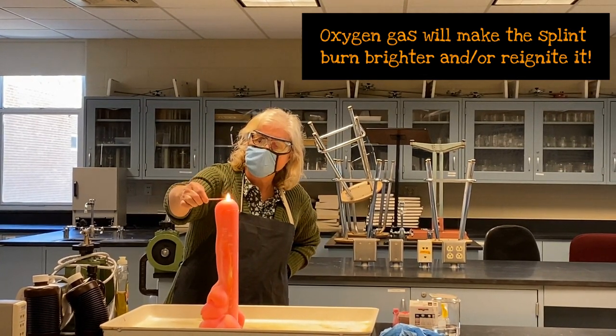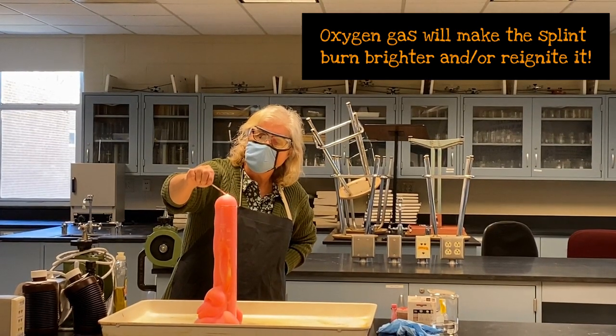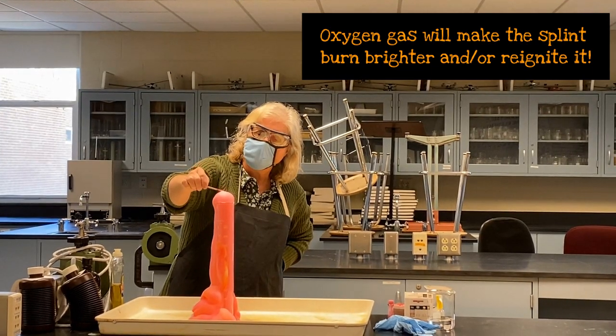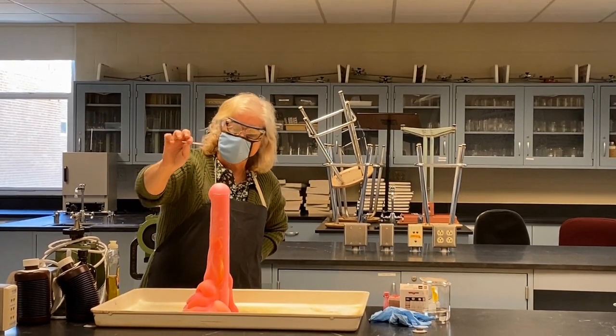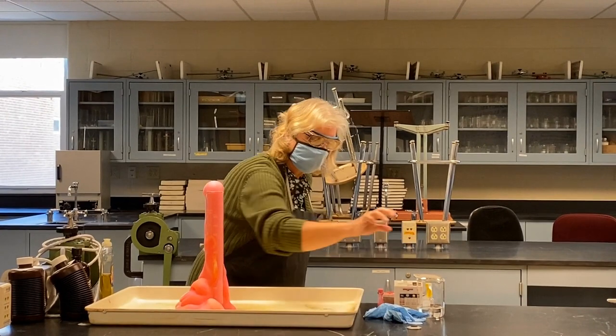So the splint is burning more and more intensely as it encounters the oxygen. Oh, there we go, I got some reignition there. It's hard because the bubbles themselves have water in them, so they're smothering the flame. But I think you got the idea with the reignition. That's caused by the oxygen.